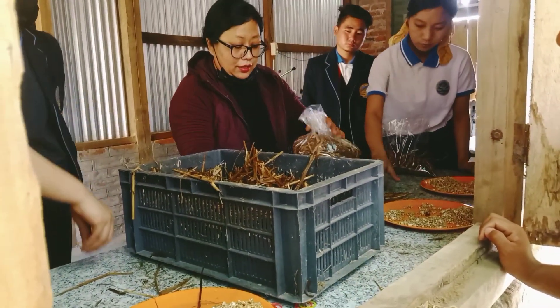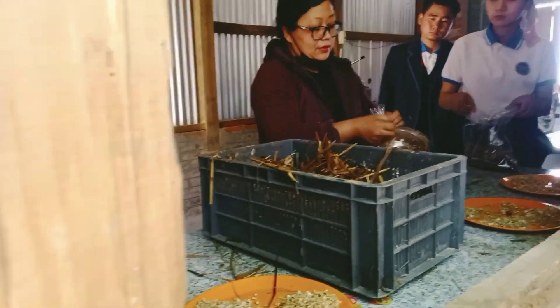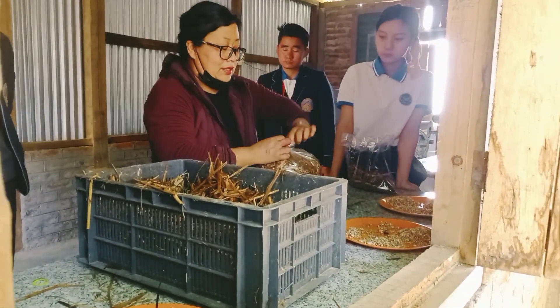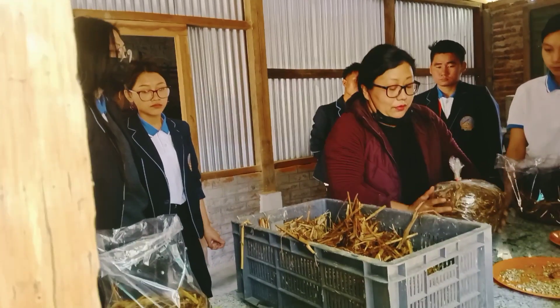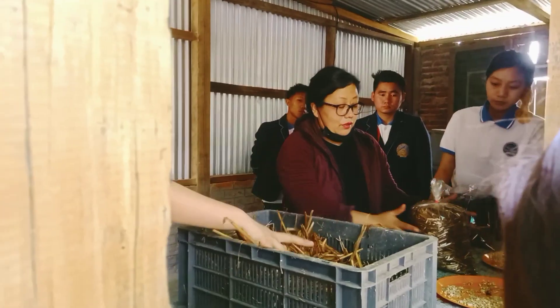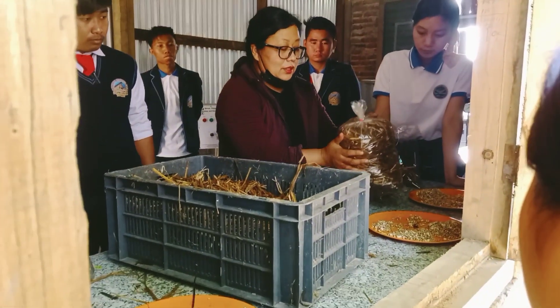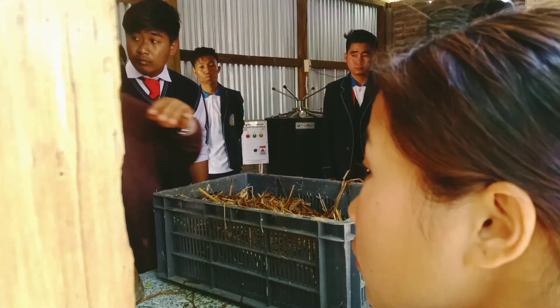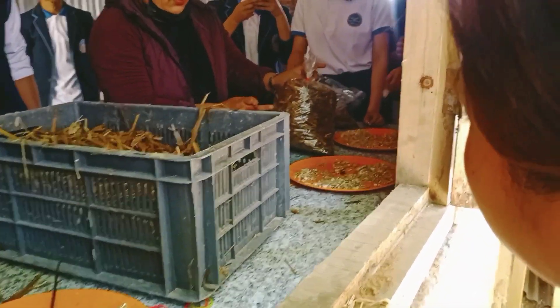We hang the package with a rope. We also put cotton inside, and then place it accordingly. After writing your name on the bag, you plug the hole. We'll keep one like this, and in another one, please bring the bottle — make sure that there is exchange of gases.